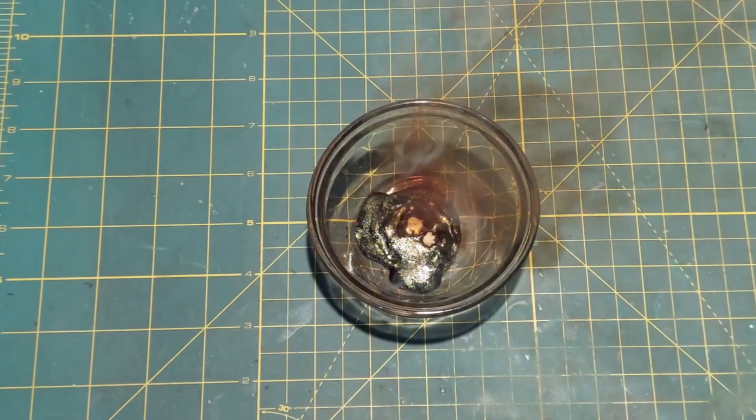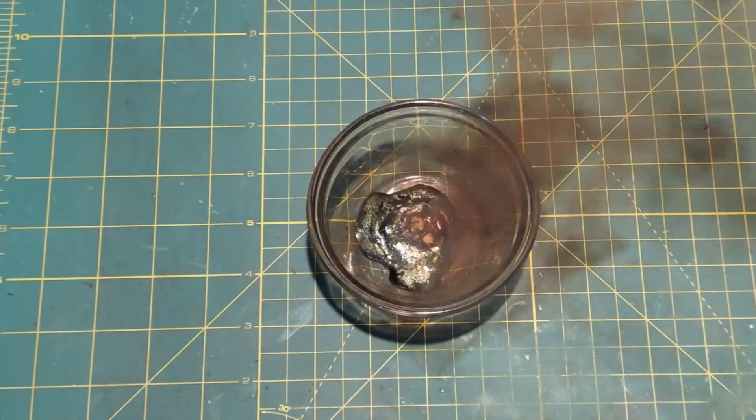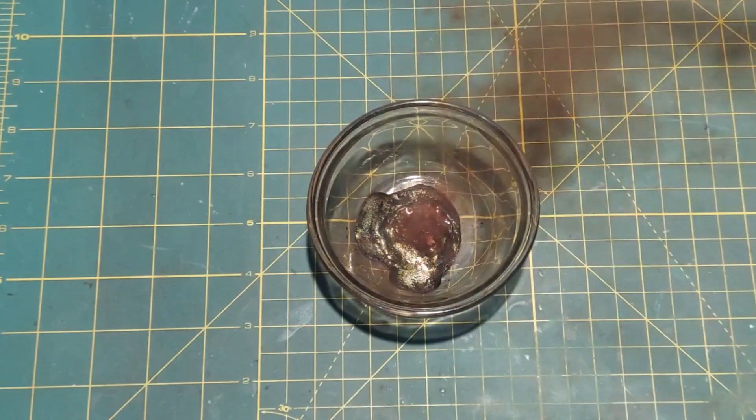I've never done this. Well, look at that. The popcorn really reacts quickly to this stuff. Oh my gosh. Time to turn on the fume hood.